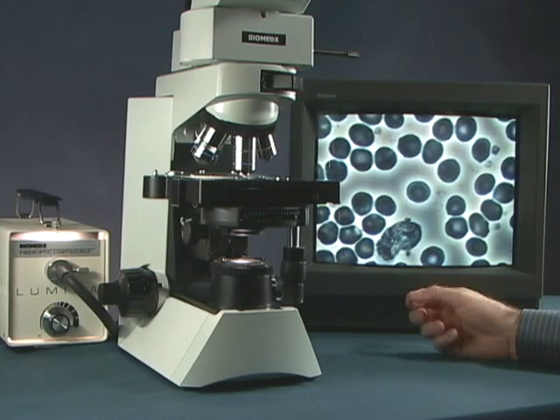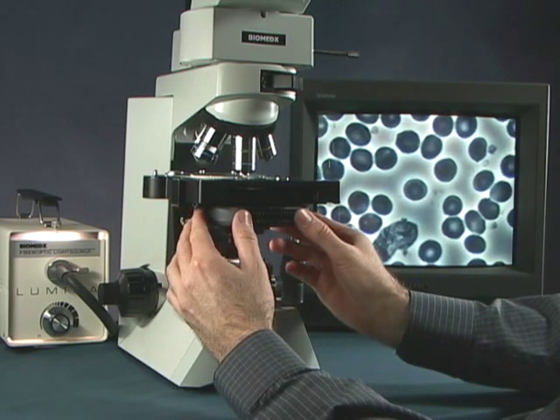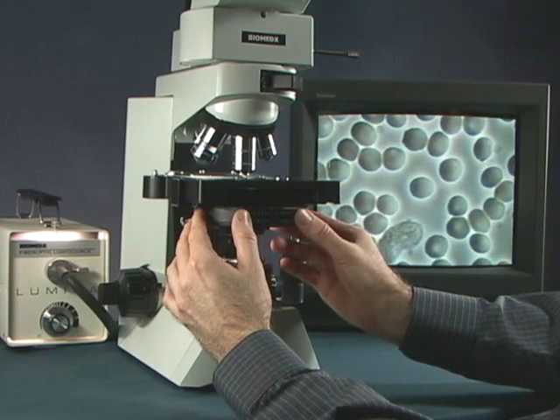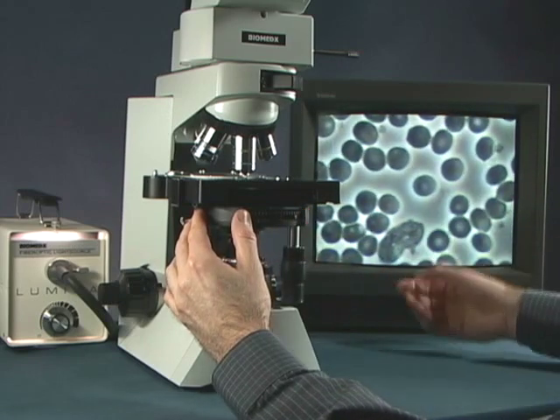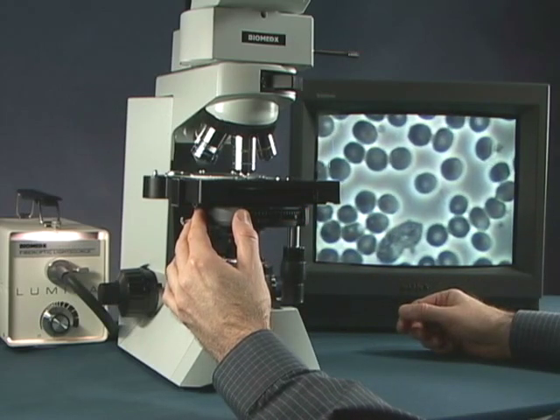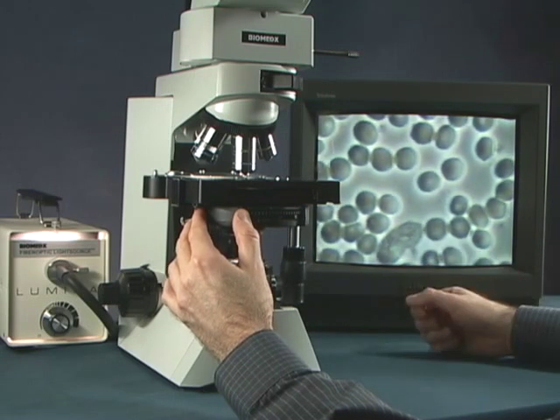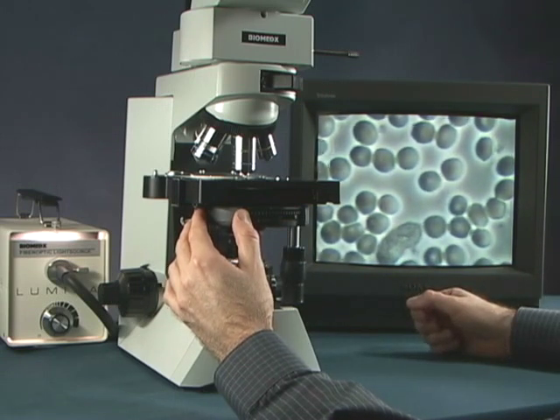Now sometimes you might be looking at an image and perhaps it looks something like this. It's somewhat washed out or there's more dimensionality to the image like this. Well that could be two things.